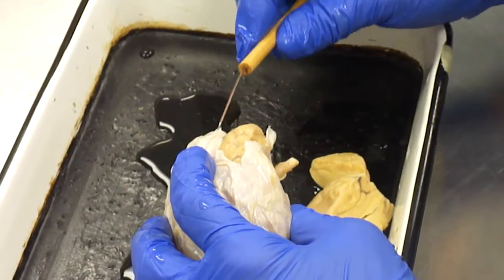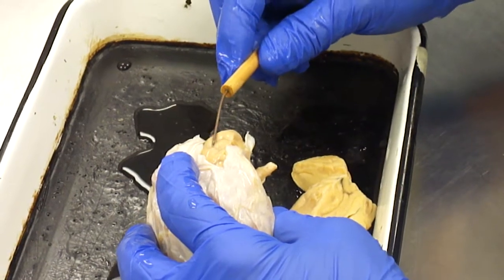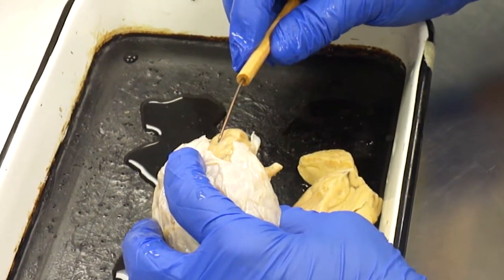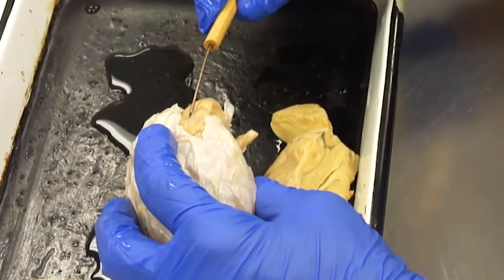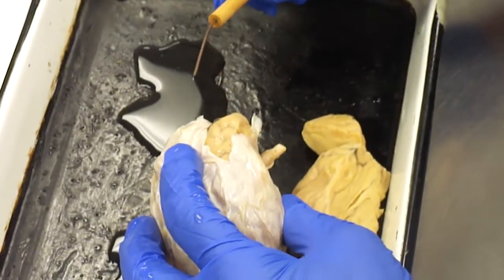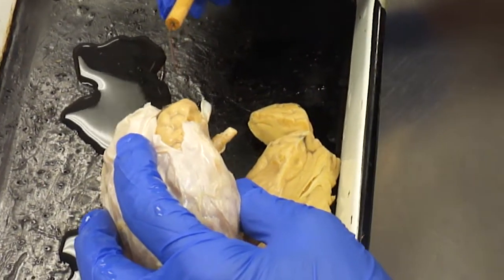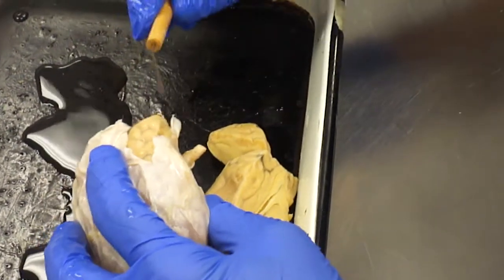And then the innermost lining, the one that sits right on top of the brain itself, if you can pick it up, see I picked up that little thing there, okay? That's the pia mater, P-I-A, pia mater, and that means gentle mother, okay?